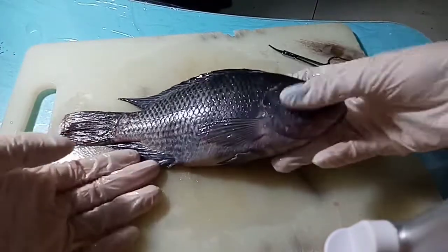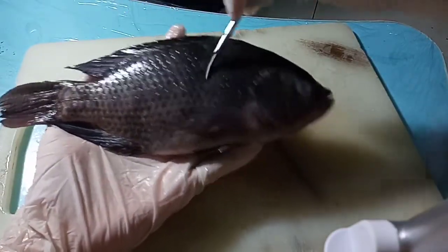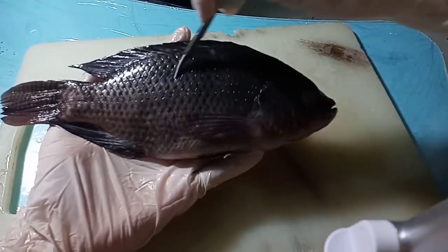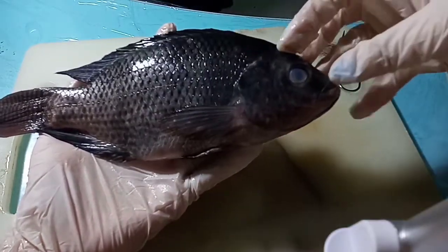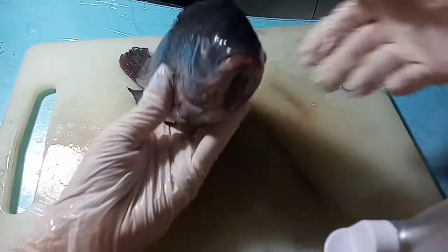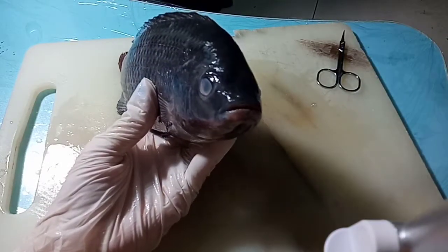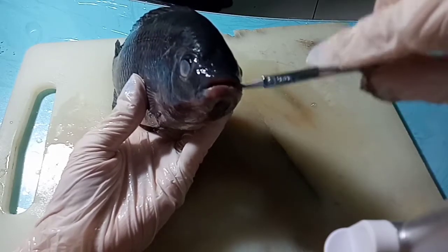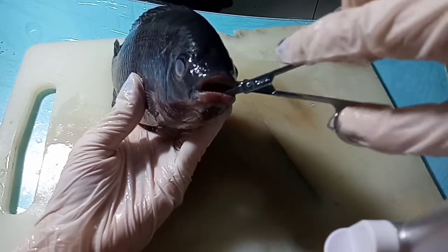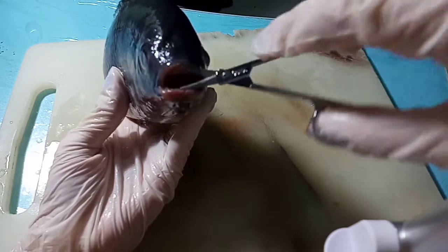Here, we could see that the fish has scales. In the head region, the tilapia has a mouth — mouth and eyes. Inside the mouth, there's teeth and a tongue.